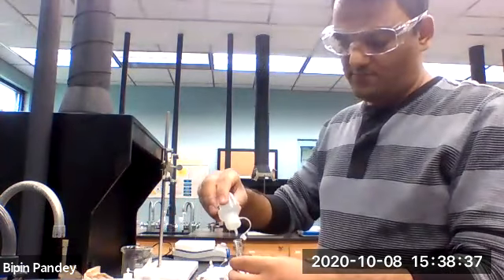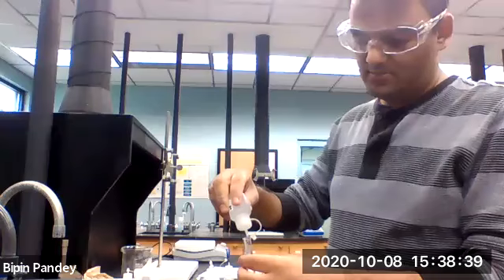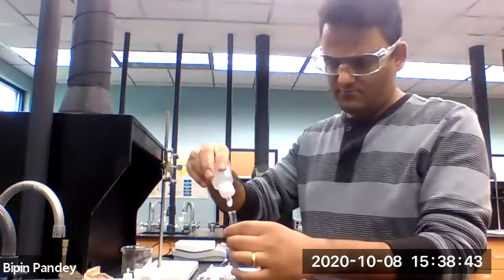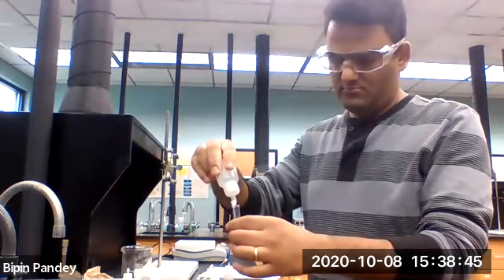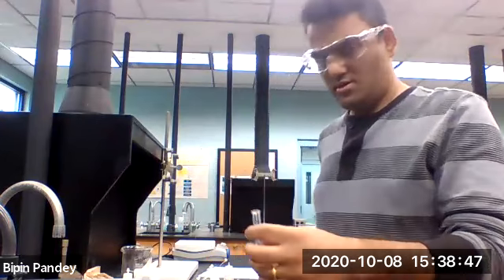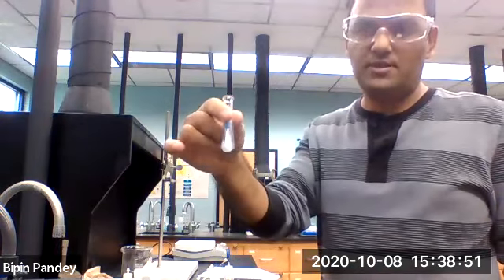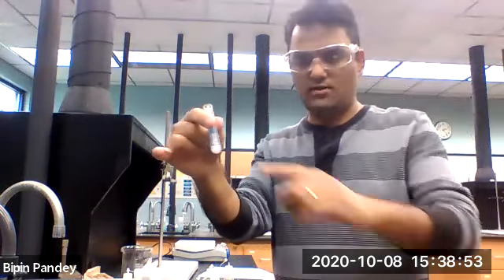Let's look at aluminum and phosphate. Okay, so aluminum and phosphate reacted and gave us a white precipitate. White precipitate, there's a reaction.